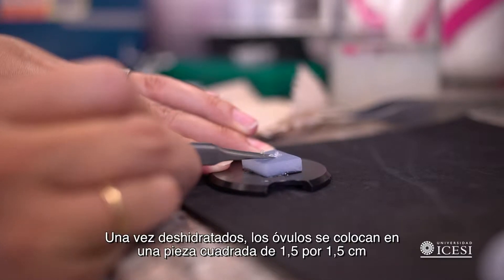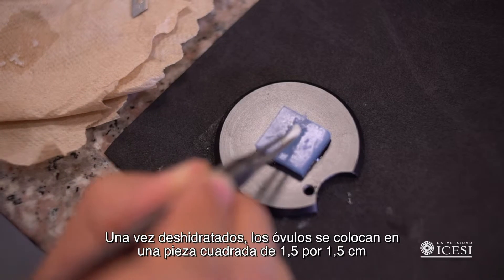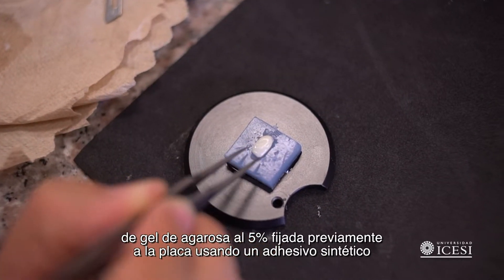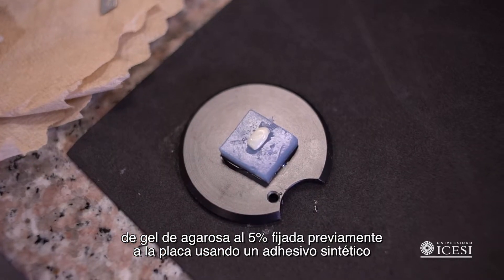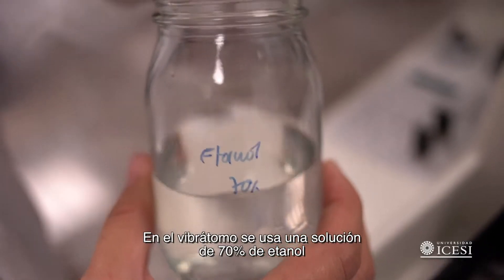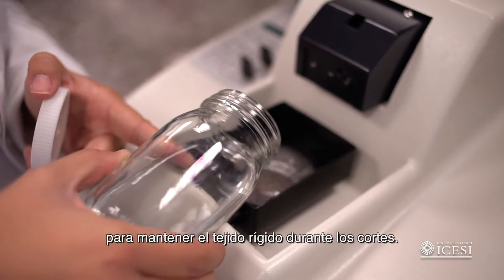Once dehydrated, the ovules are placed onto a one-and-a-half by one-and-a-half centimeter square piece of 5% agarose gel, previously fixed to the plate using a synthetic adhesive. A solution of 70% ethanol is used to keep the tissue stiff during the cuts.